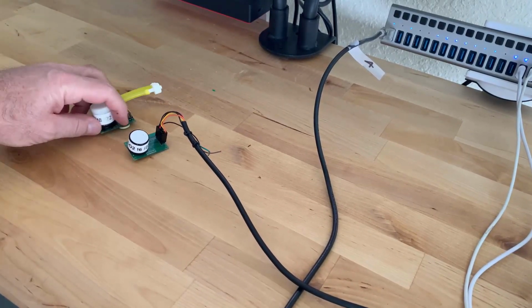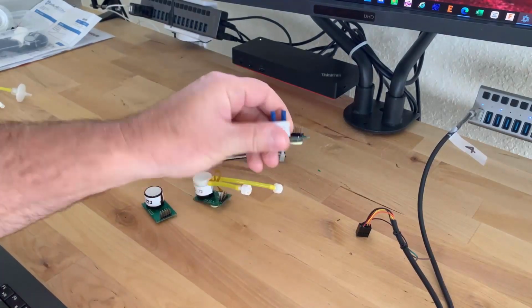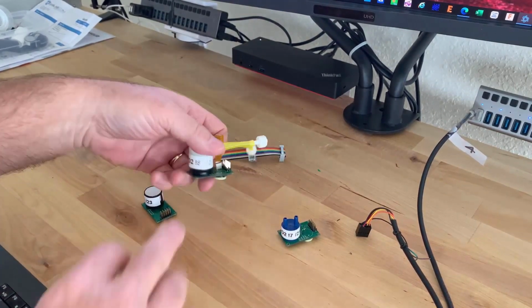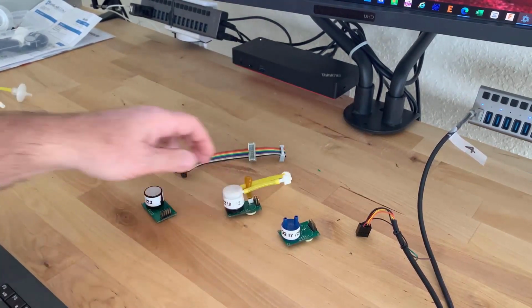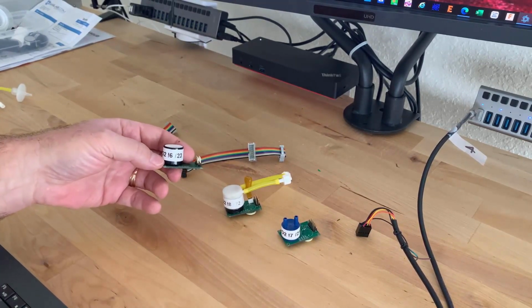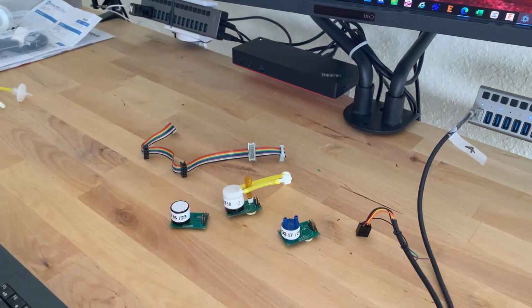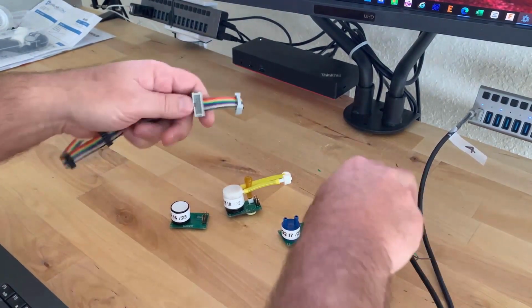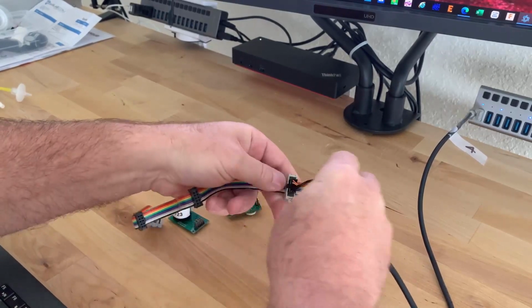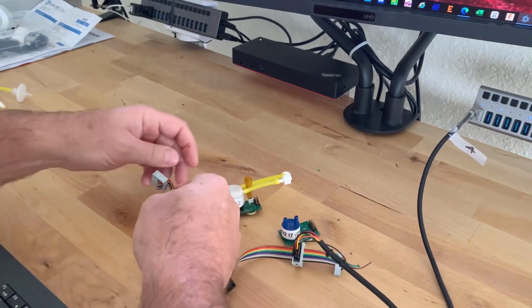So each one is going to have an address on it. All these sensors have already had addresses assigned. This happens to be an oxygen sensor, which has address 07. This is a CO2 with a tube cap, which happens to be 08. And this one here is a 5% CO2 sensor and happens to be on address 6. To hook them up, I'm going to take my RS485 cable here and plug it in. And then I'm just going to start hooking sensors onto this.